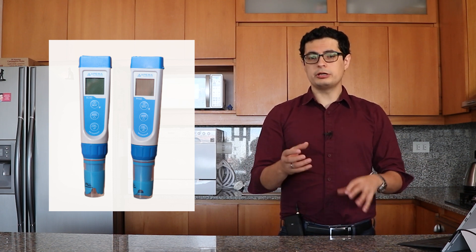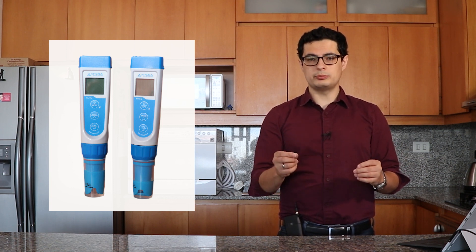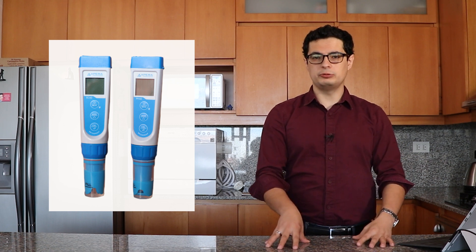Not only does it automatically compensate, but it also shows you the actual temperature reading on the display so you can record temperature as you take the conductivity reading without needing two separate instruments. This saves you the hassle of performing manual corrections and is especially important when reading different conductivities as a function of time and in different places — for example, EC readings of irrigation solution and runoff solutions for run-to-waste systems.